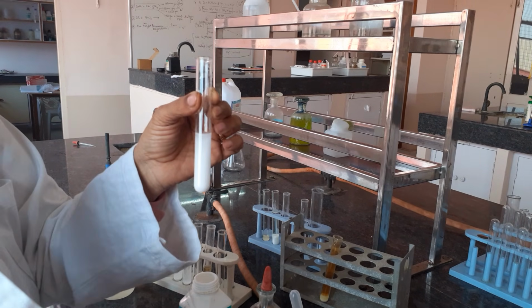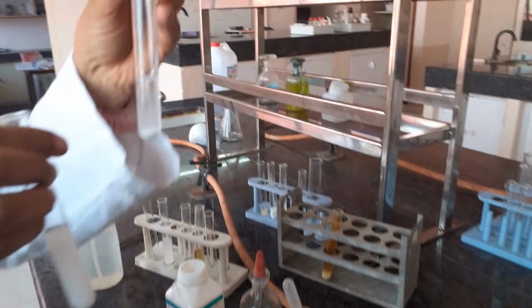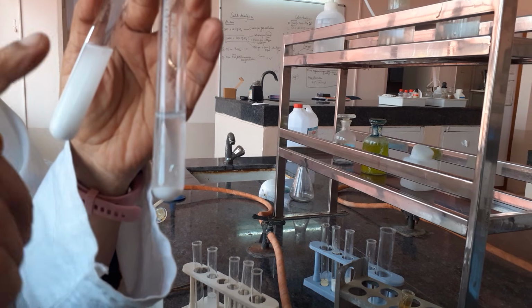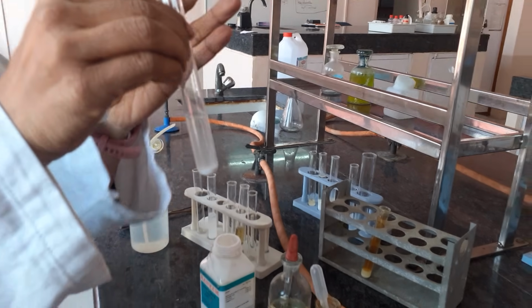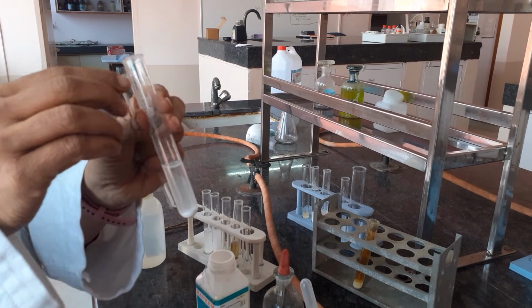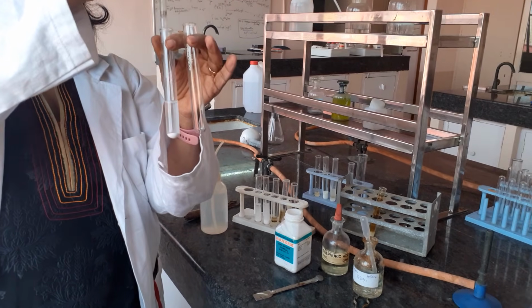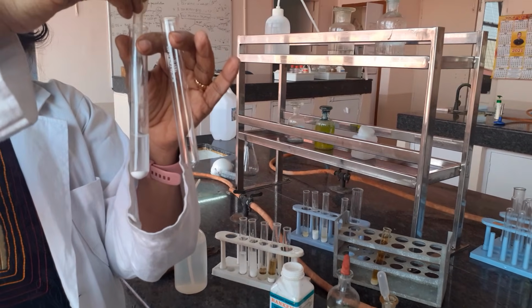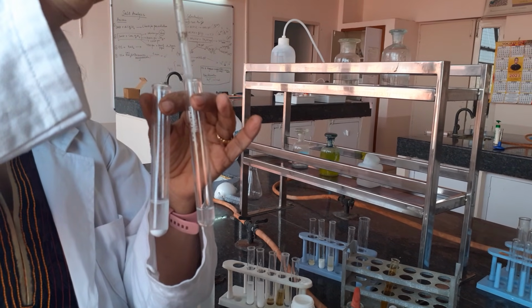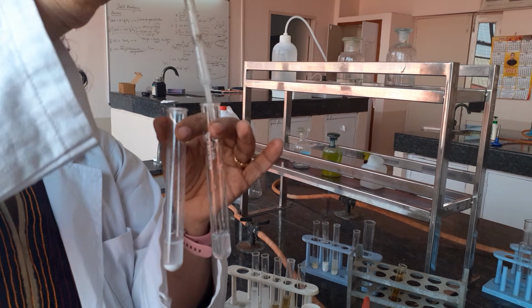Wait for some time so that the precipitate of lead sulfate settles down. Now this experiment I did a while back. This is my other test tube where I have waited and this ppt has settled down like this. Once this ppt settles down, wait for another two, three minutes. Now take the upper liquid into another test tube, carefully take the liquid from the top and transfer it into another test tube. That is the better way of doing the test of nitrate, so I am transferring my liquid from this test tube to this.